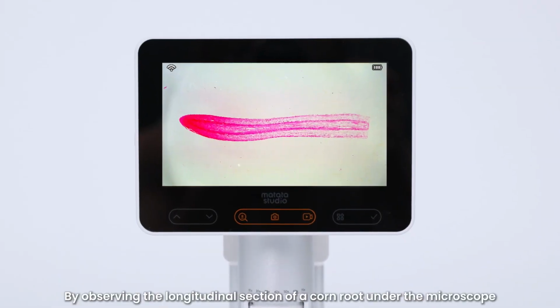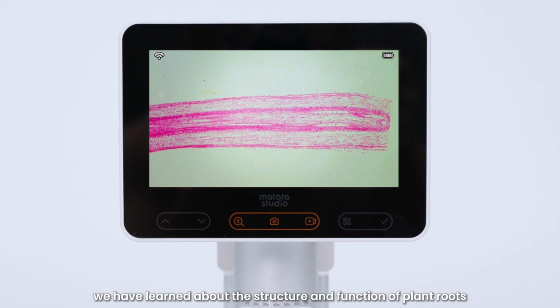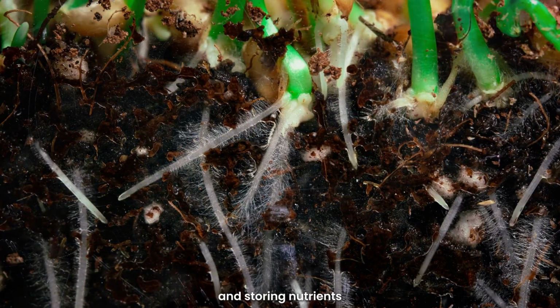By observing the longitudinal section of a corn root under the microscope, we have learned about the structure and function of plant roots. Roots play an important role in absorbing water and nutrients, providing support, and storing nutrients.